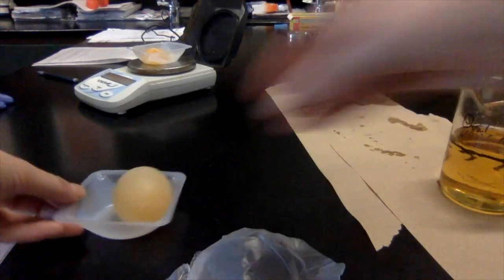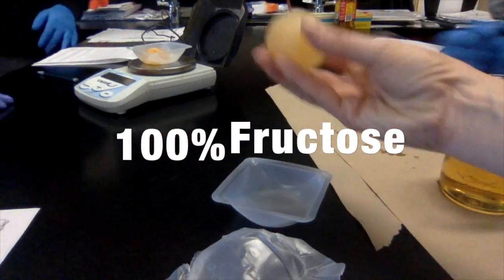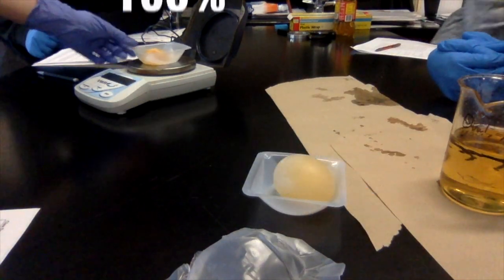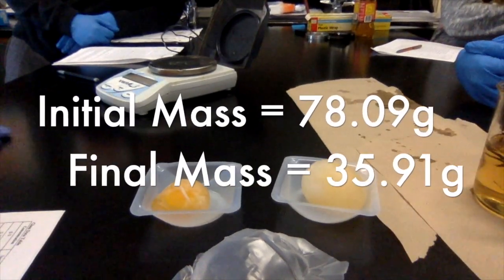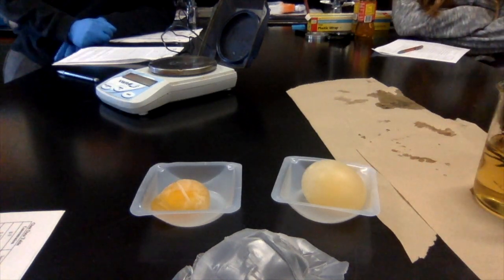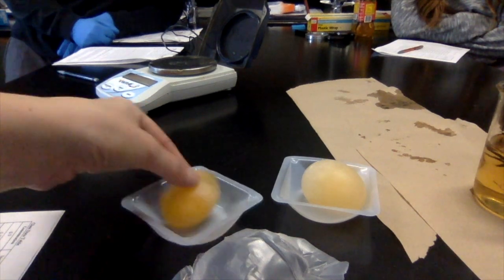Tell me, let's compare. So this is what the egg would have looked like to begin with. It's obviously not the same egg, but it's approximately what it would have looked like before. Now bring that egg on over and tell me what you notice happened to your egg. It basically deflated. All right. So what exactly would have left? The water. Okay, the water left.